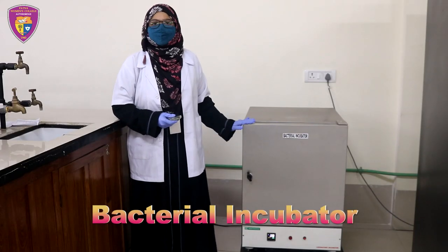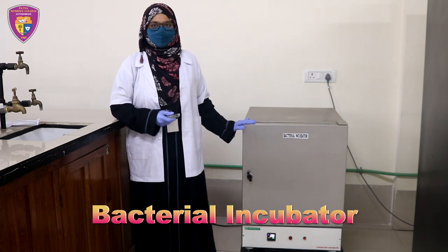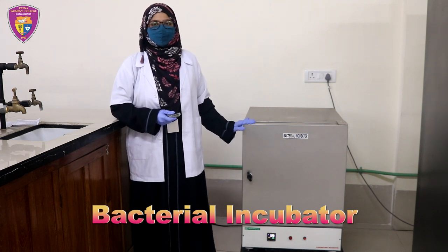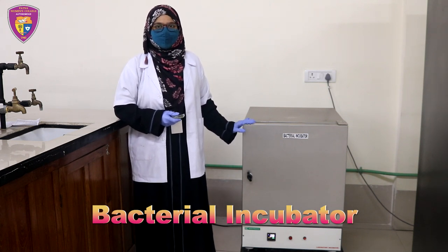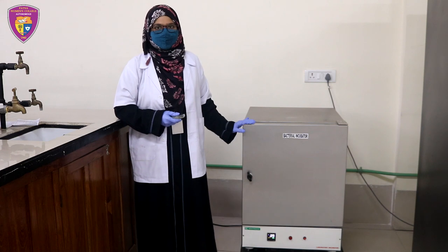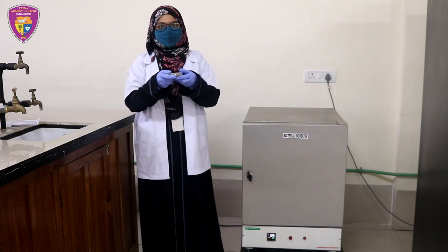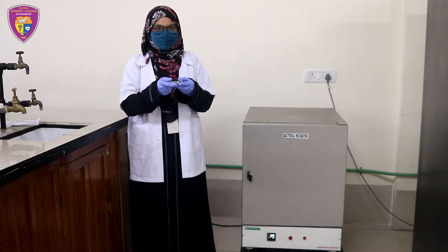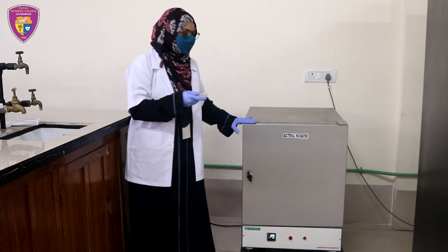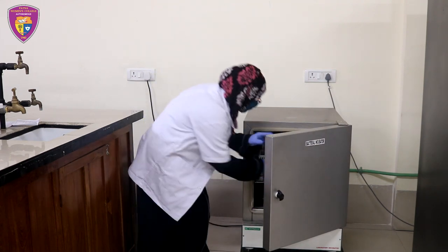This is a bacterial incubator and it is a device that we use to grow and maintain a biological culture inside. Now I am going to keep this culture inside the incubator at 37 degrees centigrade.